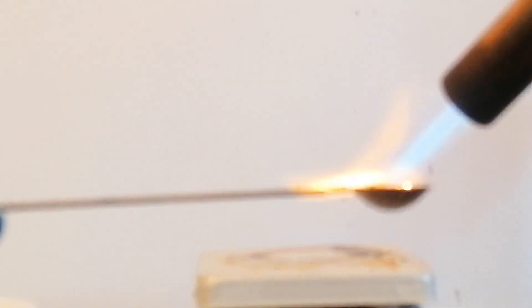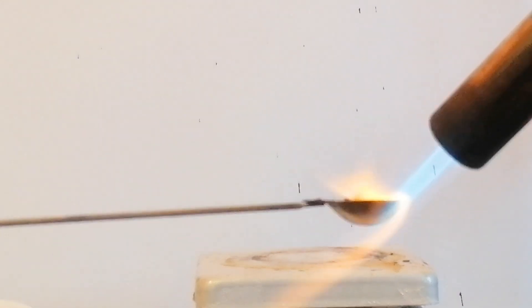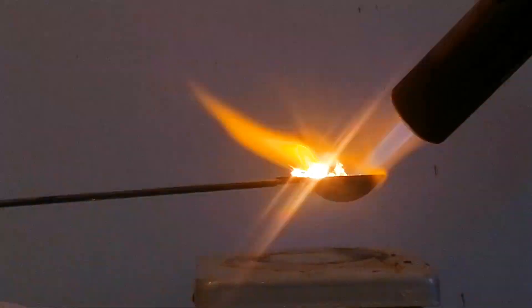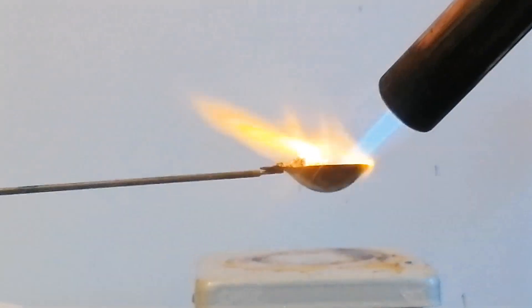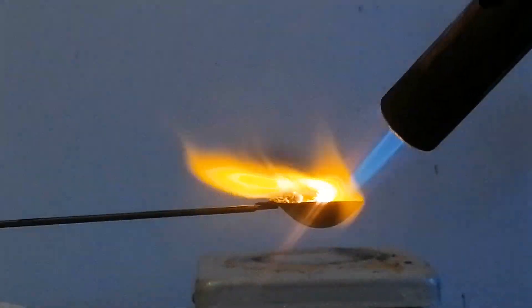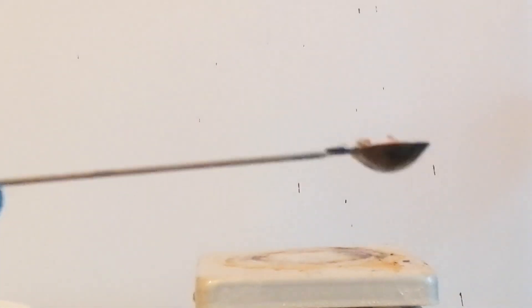So just for fun, I took some of the yellow iodoform, added some magnesium into it, and blowtorched it. Well, that was a pretty cool flame. However, to my surprise, none of the iodine vapors came over. It's most likely because they reacted with the magnesium as they were being liberated from the decomposing iodoform.